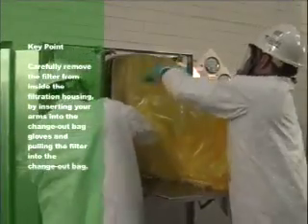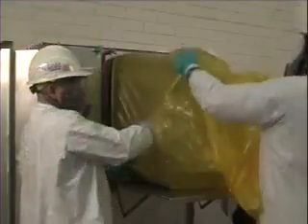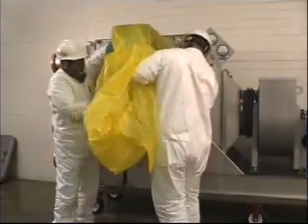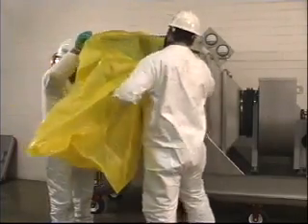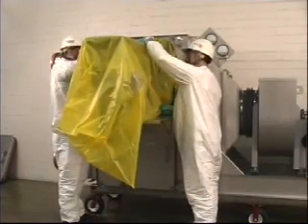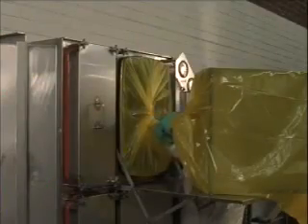Carefully remove the filter from inside the filtration housing by inserting your arms into the change-out bag gloves and pulling the filter into the change-out bag. Use a table or change-out shelf to place the filter after removing the housing. Remove your arms from the change-out bag gloves, leaving gloves in bag. Once the filter is removed from the housing into the change-out bag, tightly twist the change-out bag together between the filter access port and the contaminated filter.